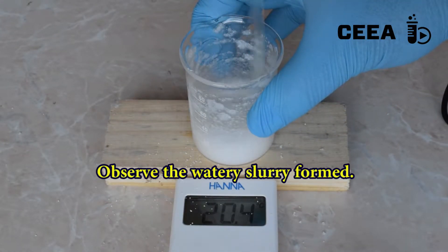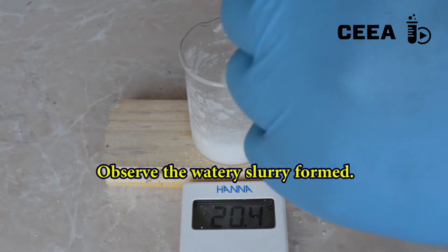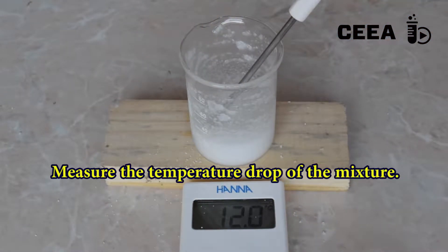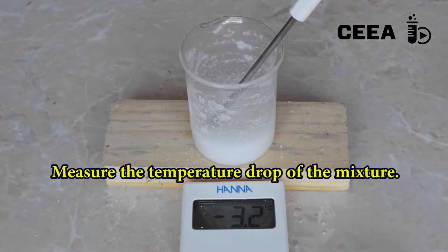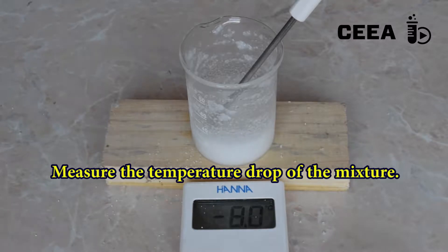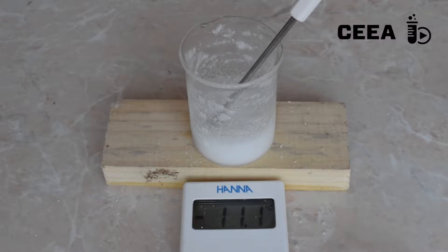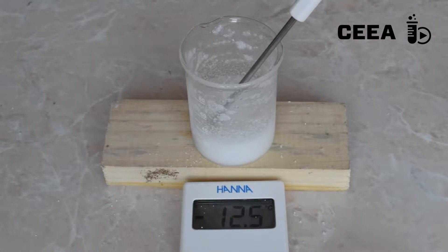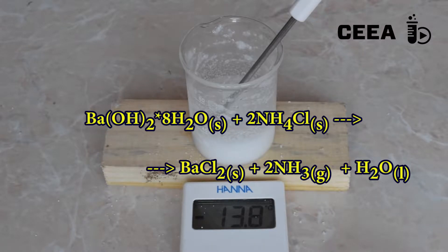Observe the slurry formed. Pay attention as toxic ammonia gas is evolving. Measure the temperature of the slurry and observe you can get a 37 degrees Celsius drop, down to minus 17 to minus 20 degrees Celsius.